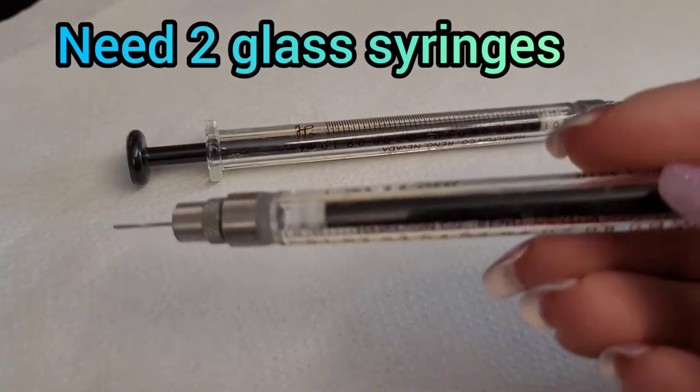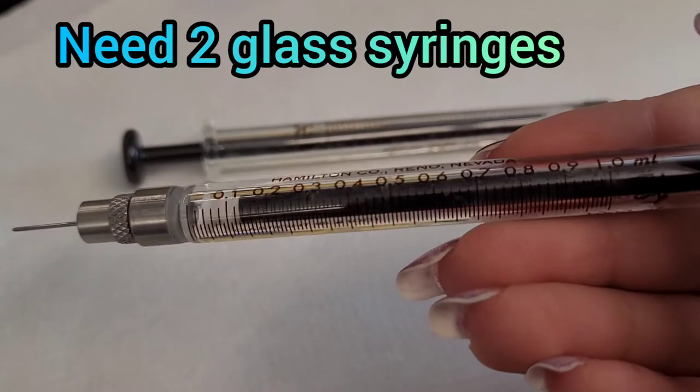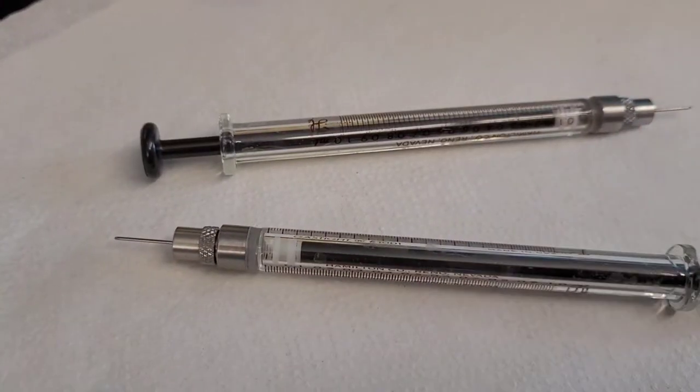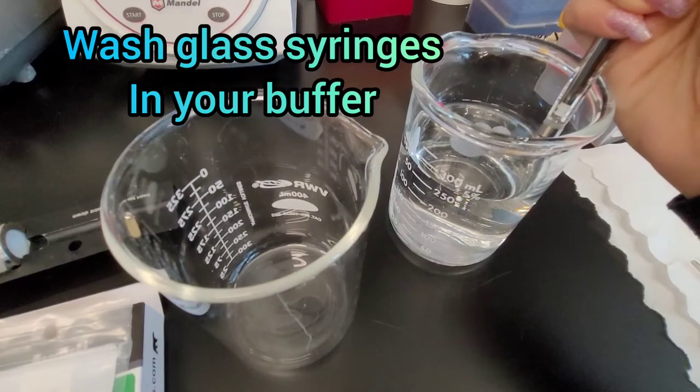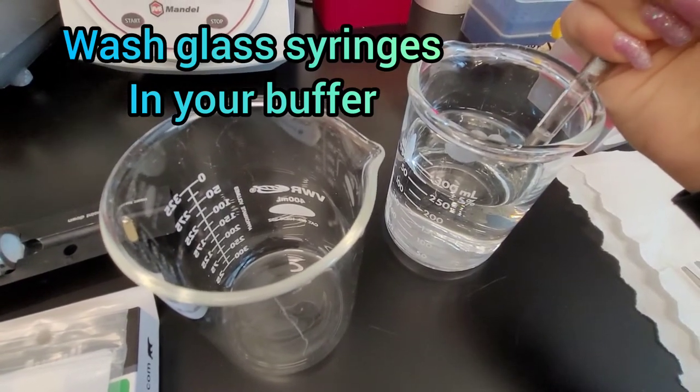Then you need two glass syringes like these, and first you have to make sure they are washed well in your buffer.